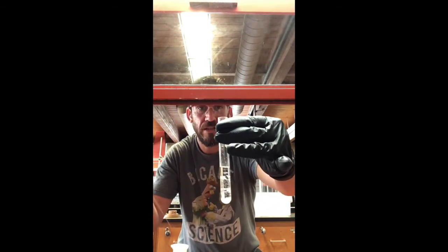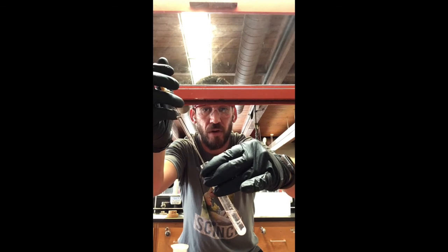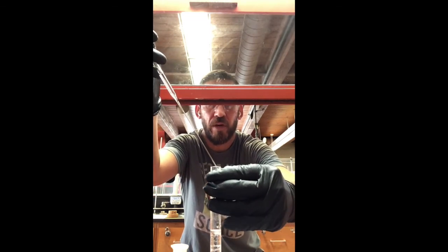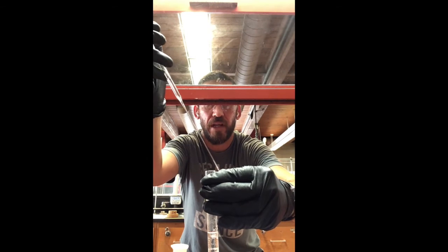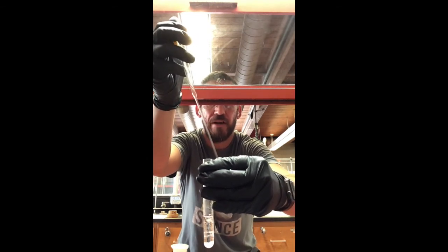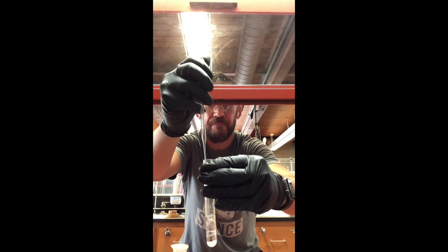So holding these 2 things. Now, when we're transferring the methylene chloride, it's really important that we're careful. Sorry, I need to focus for a second. It's dripping pretty fast, so I've got to be fast in when I choose to move that into the Erlenmeyer flask. So I typically wait for a drop and then go right after that, after I've timed how quickly those drops are dripping, okay?